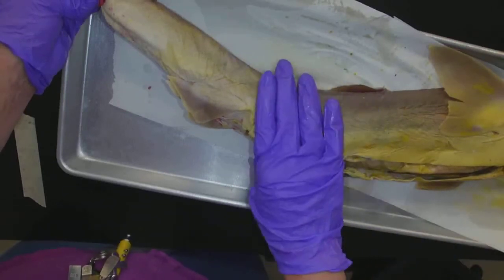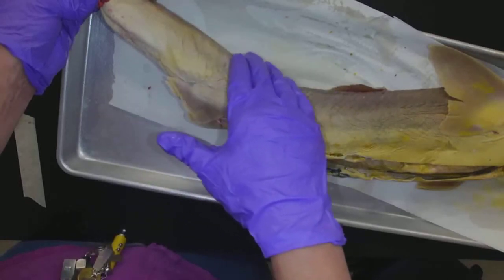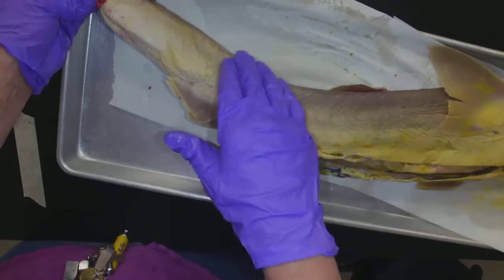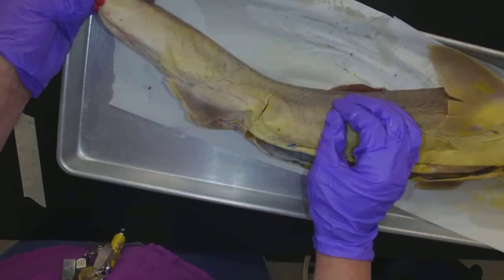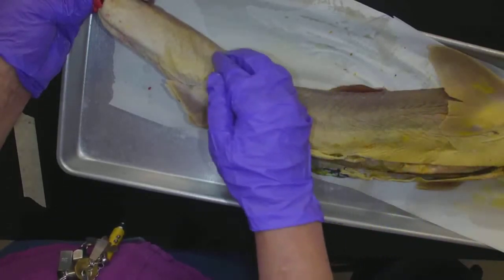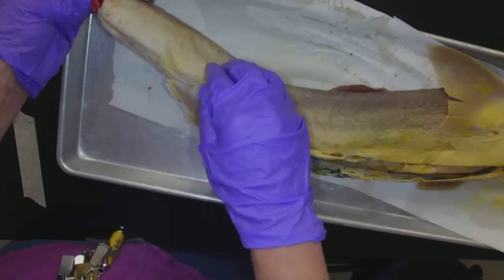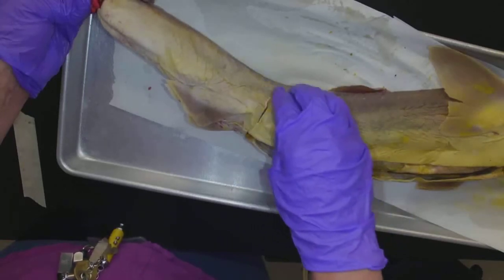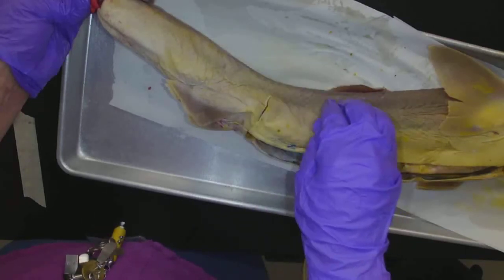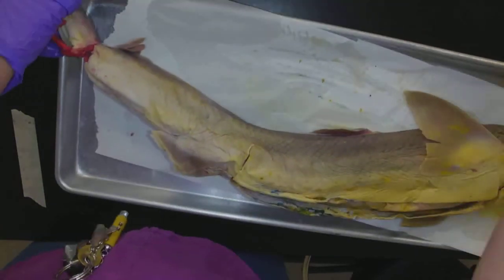As you can see, it's already been cut open and dissected. When I pet the skin one way, it's very smooth and soft, but going the other way, it sounds like sandpaper — those are the scales on the skin pointing in one direction, so going backwards I'm grabbing all the little hooks. They have a very rough feel to the skin going that way, but not this way. Okay, that's enough for external anatomy. Next will be internal anatomy.